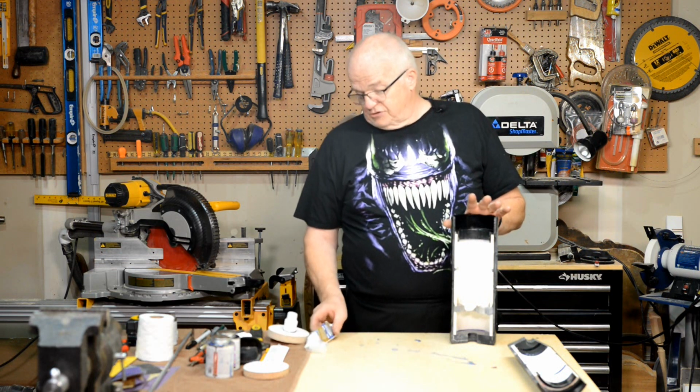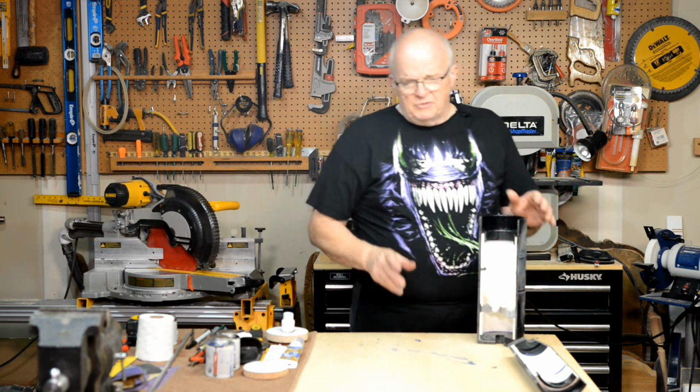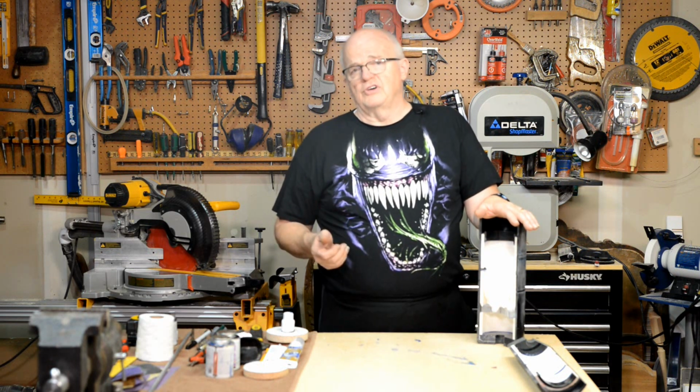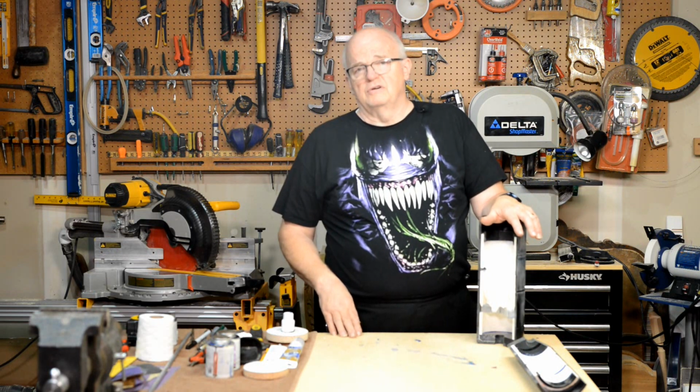That silicone has to cure completely. And another thing, before you put your O-ring in, make sure you wash it off with some warm soapy water, because when they're manufactured, they have a release agent on it. Sometimes you see that little white powder, and you want to wash that completely off, okay?